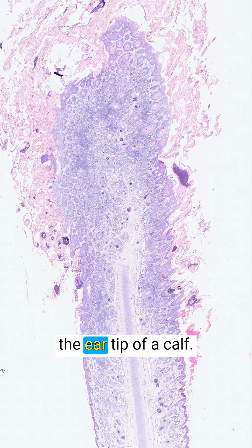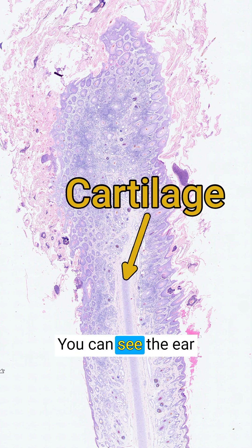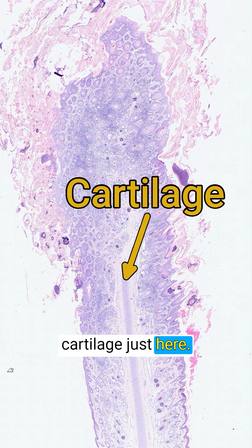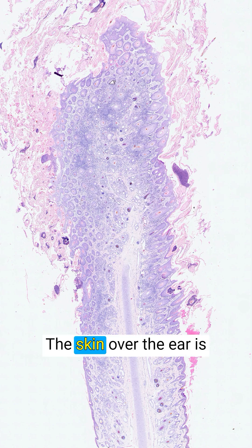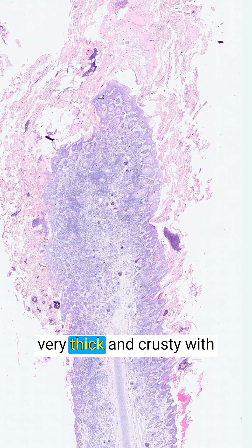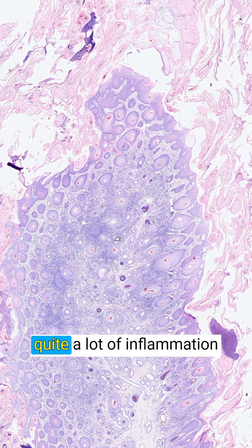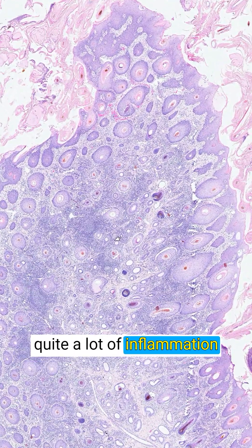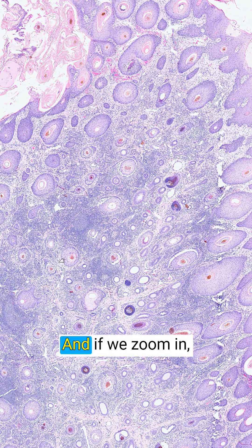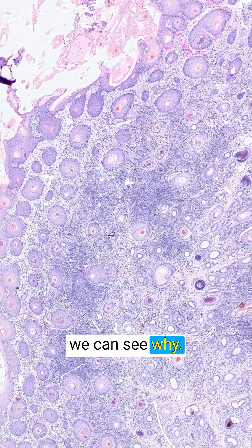This is a section from the ear tip of a calf. You can see the ear cartilage just here. The skin over the ear is very thick and crusty, with quite a lot of inflammation in the dermis underneath, and if we zoom in we can see why.